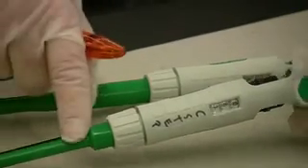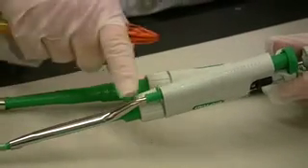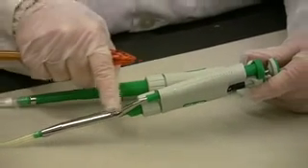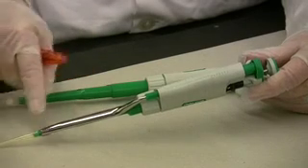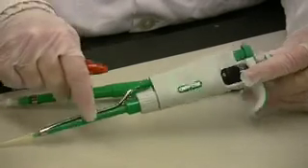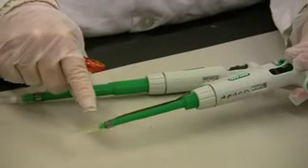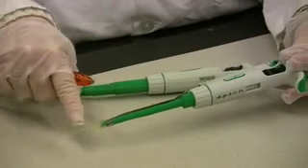Further parts include the shaft, the ejector arm, which is very important in helping to eject the pipet tip, and then finally the pipet tip itself.